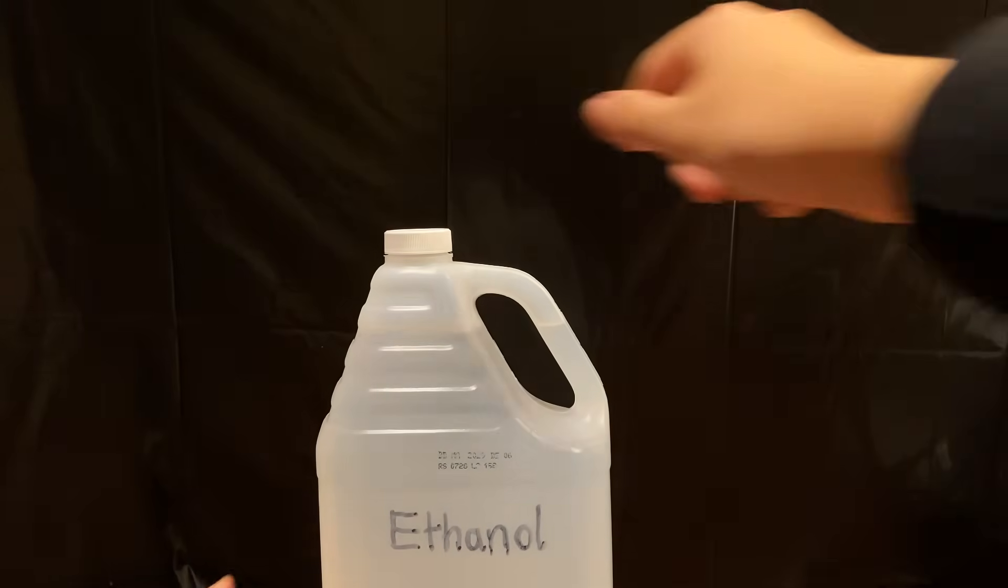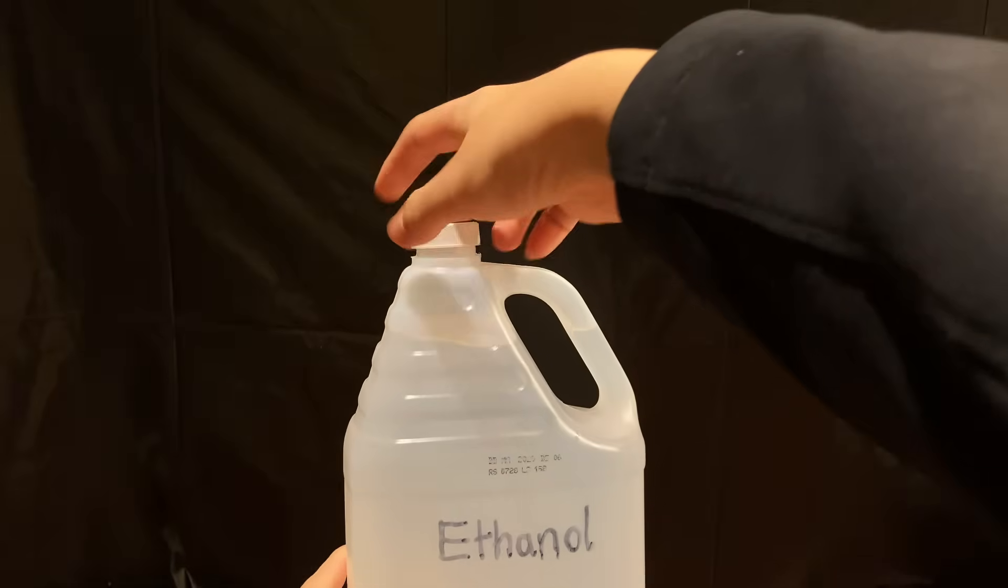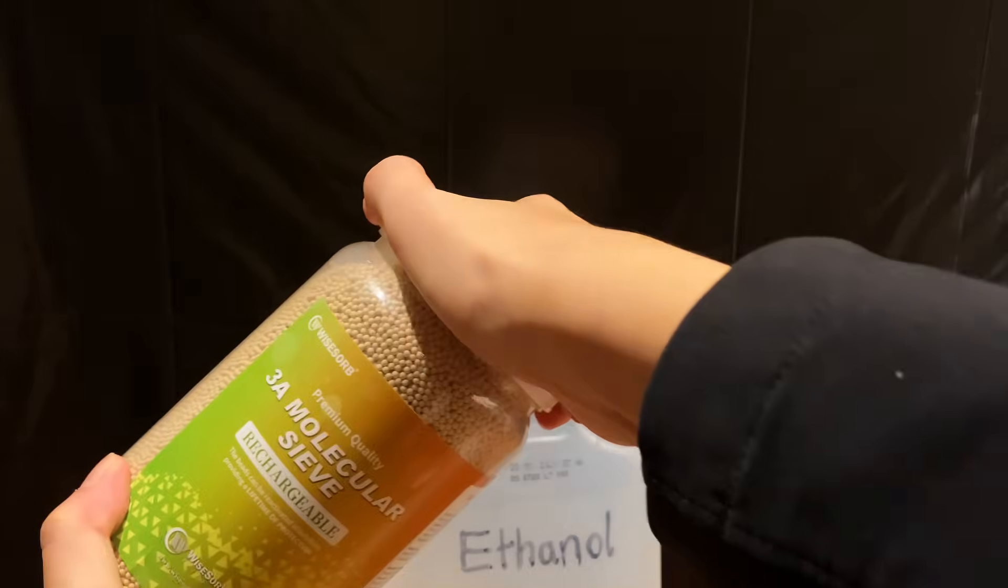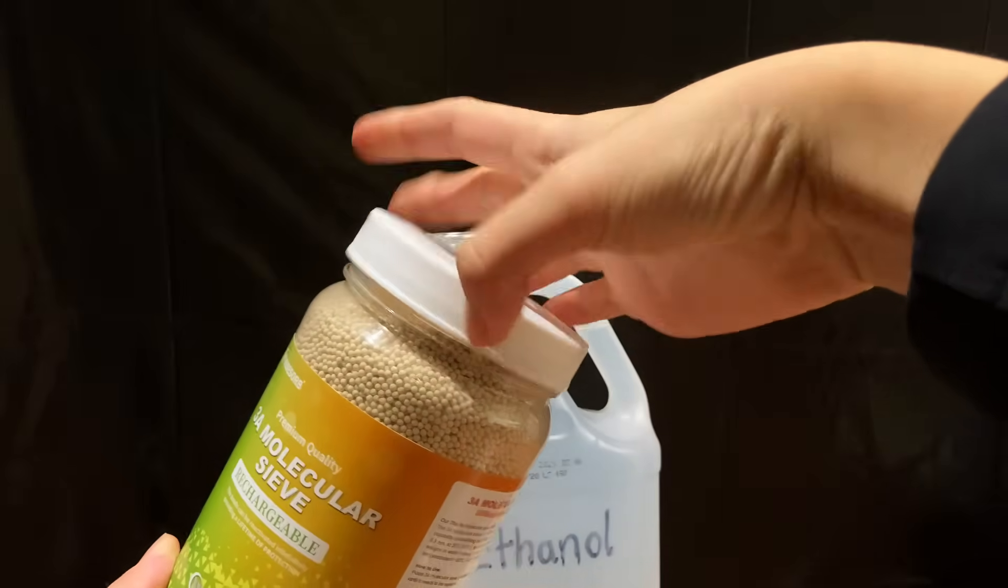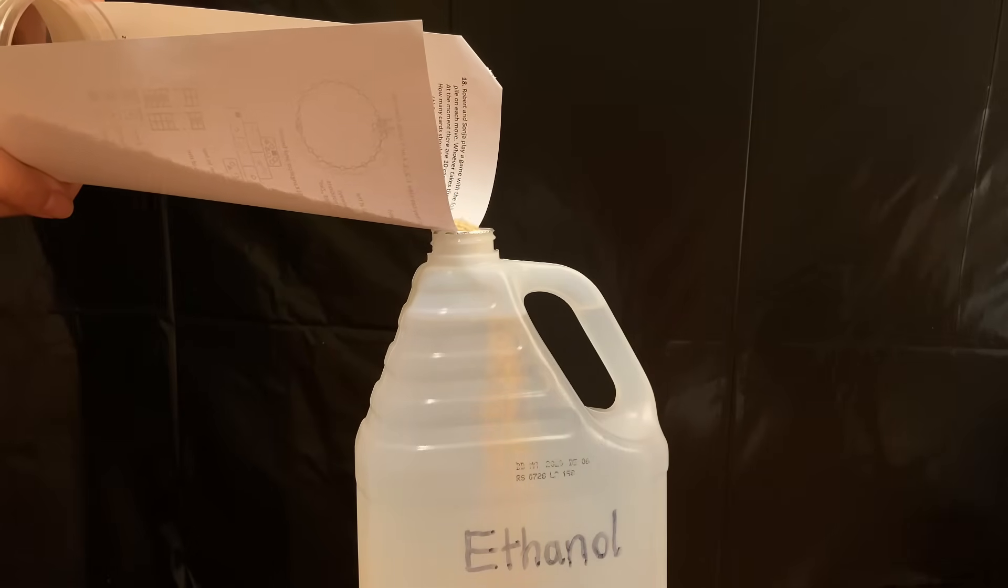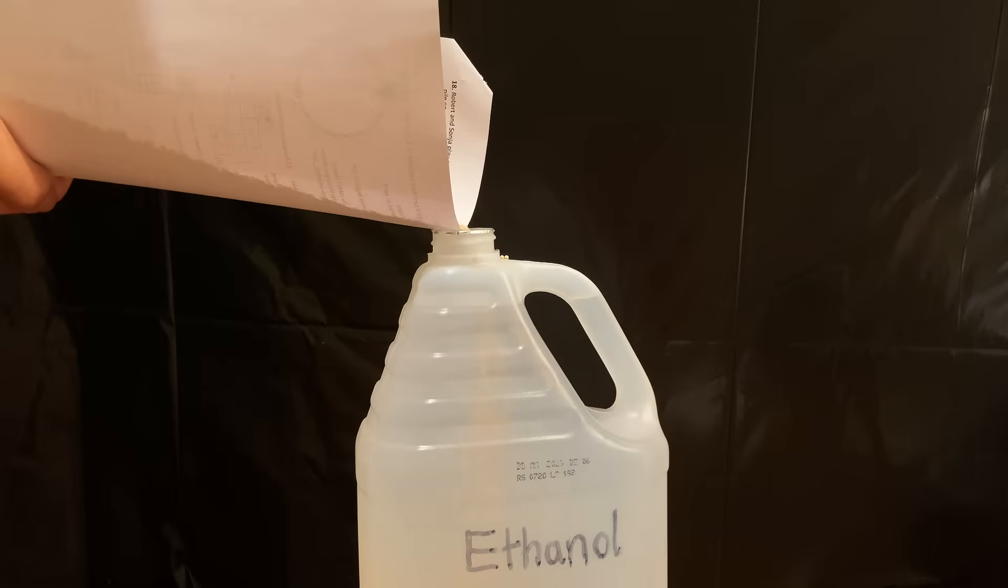Sneak peek, just for this single experiment, I somehow used an entire 2lb package of molecular sieves. Here you can see me starting to dump in the molecular sieves into each container of 95% ethanol, and using a piece of paper to guide the sieves in because they like to fly everywhere. I mean, is it just me or are molecular sieves not just the most annoying thing to work with and clean up? Like please, someone in the comments agree with me, I'd rather work with tert-butyl lithium.